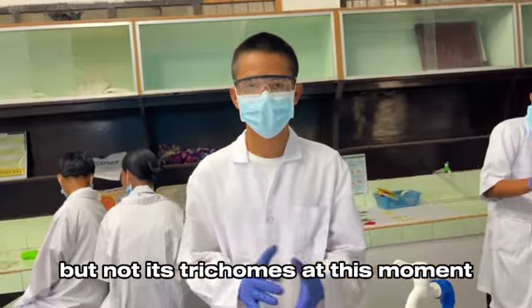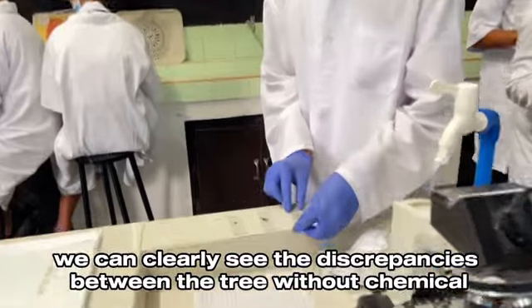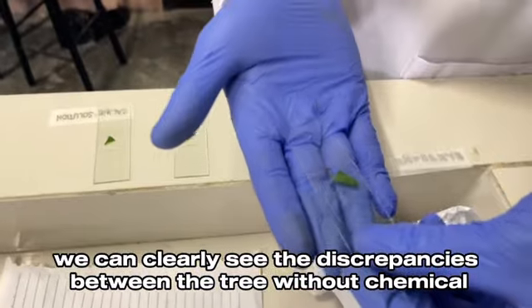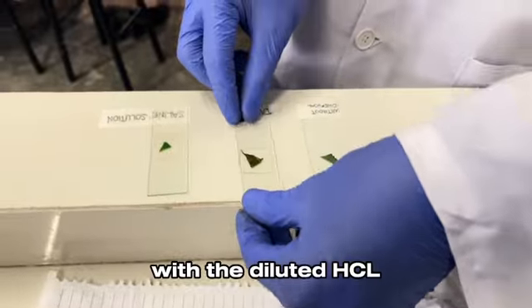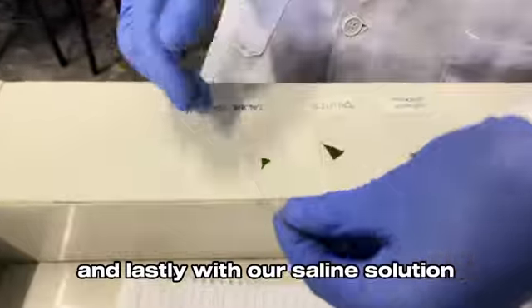At this moment, we can clearly see the discrepancies between the three. Without chemical, with diluted HCl, and lastly with our saline solution.